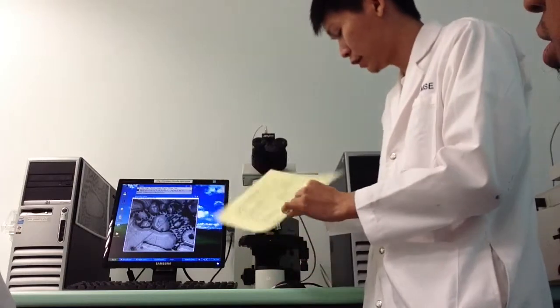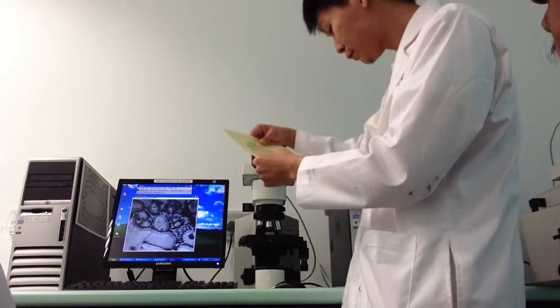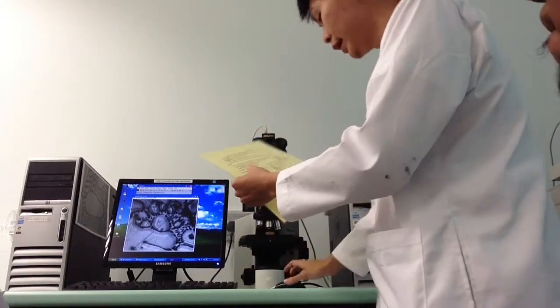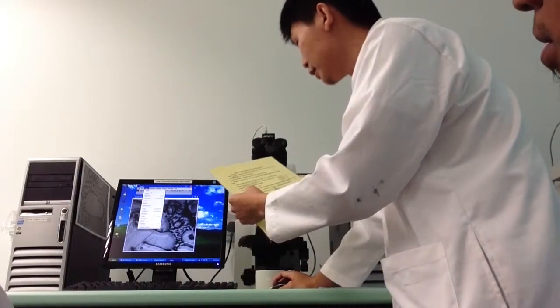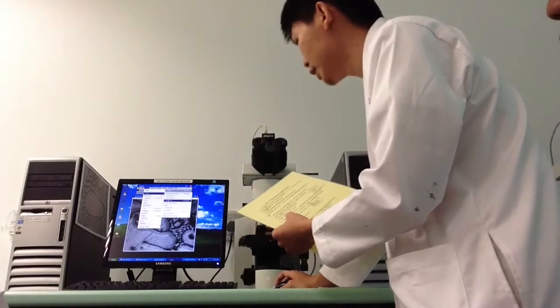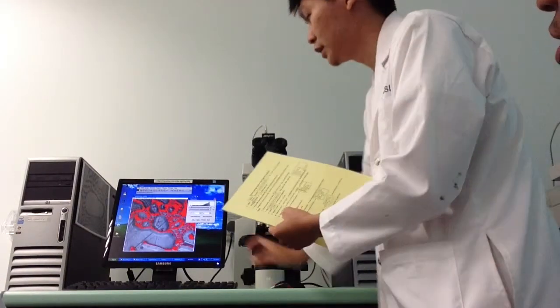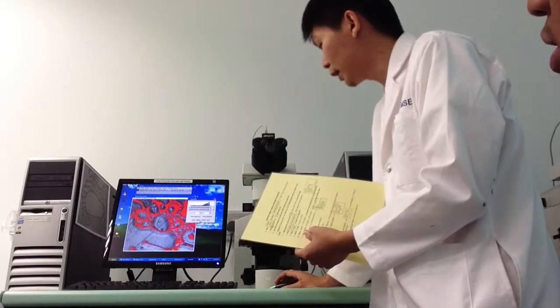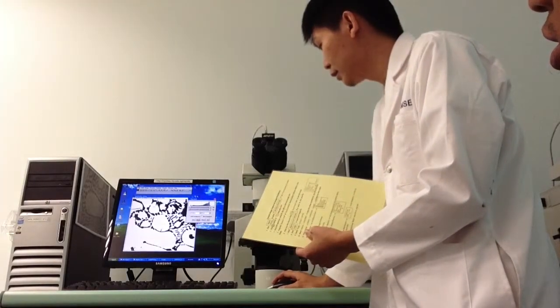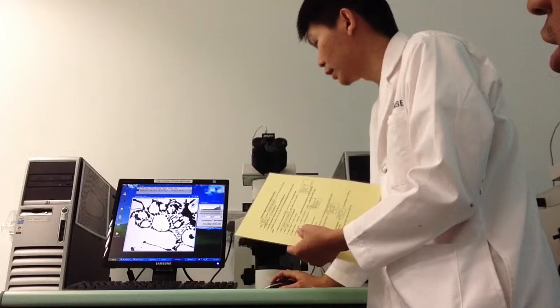You are now at step number 11. You select Image, Adjust, Threshold. Same thing, you will just select the black region. Remember to apply. This will turn it into a black and white image.